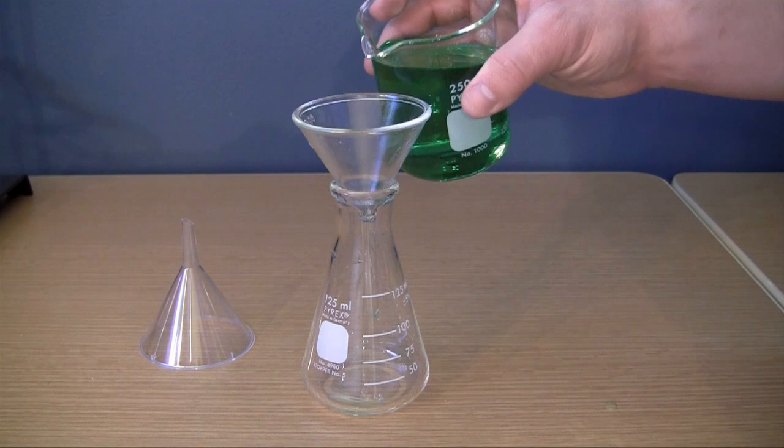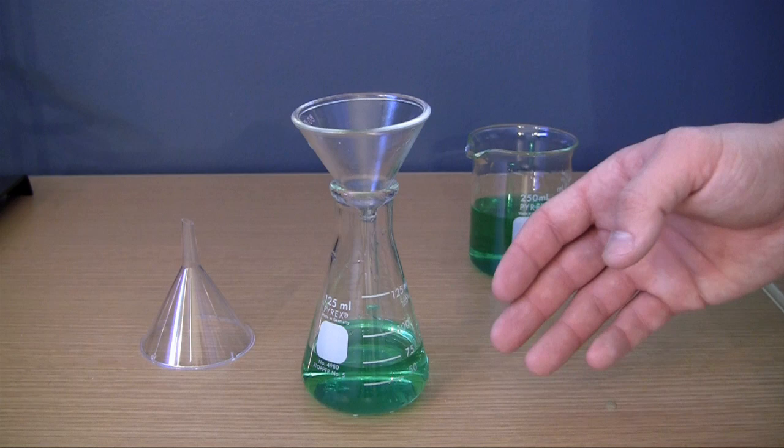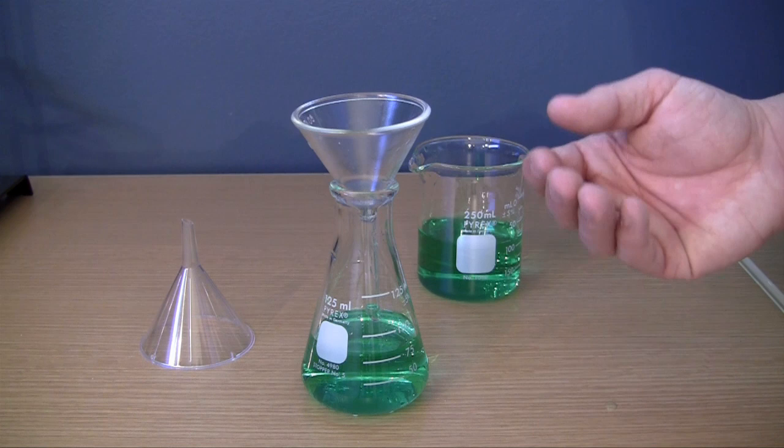Now right now this isn't working too bad but typically in a lot of situations you're going to have a really slow pour or it's not going to be very smooth. And the reason for this is because whenever you're pouring this liquid in the liquid can enter just fine but there's no space for air to enter this container so you're going to have a really slow or not smooth pour.